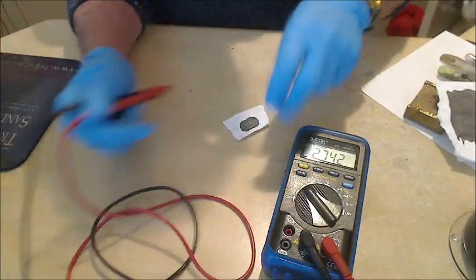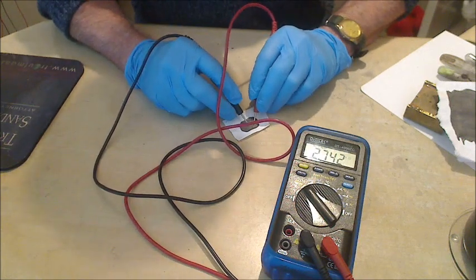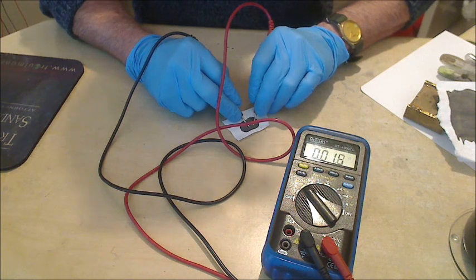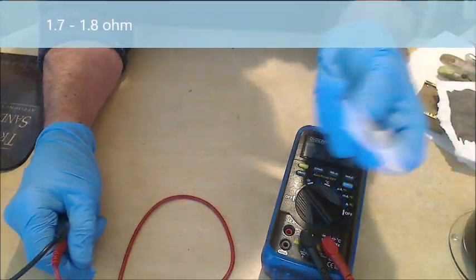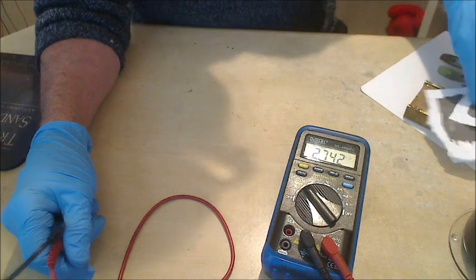I also have a small piece here which I just use for doing centimetre tests, which gives 1.8 ohms per centimetre. That again is roughly the same thickness. I think it's actually slightly thinner than that. I think that's near a 0.2, but obviously it doesn't mean a lot.